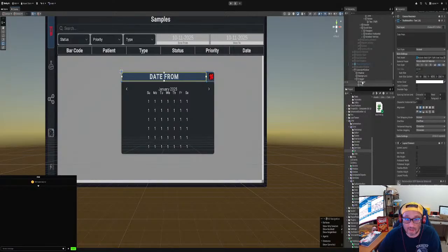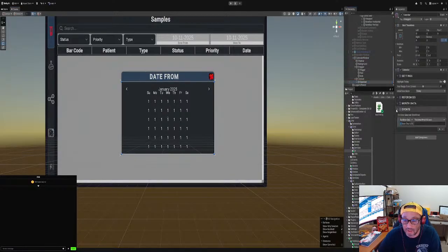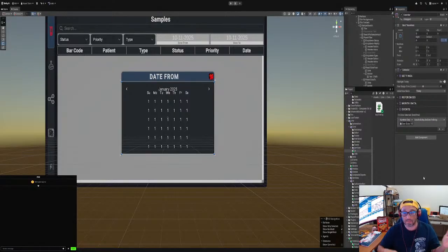So now we're in the calendar window. We're in the calendar. We're at the events. So we go here. Date, date time, and then we go the dates to string, and then set date. There we go. All right.